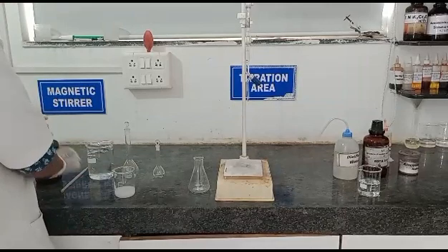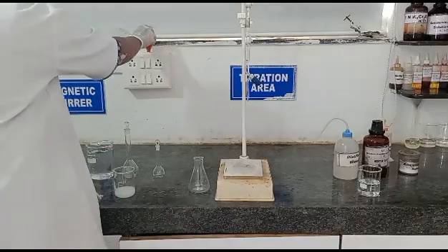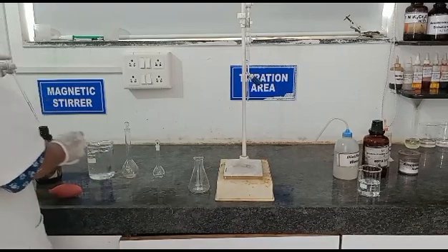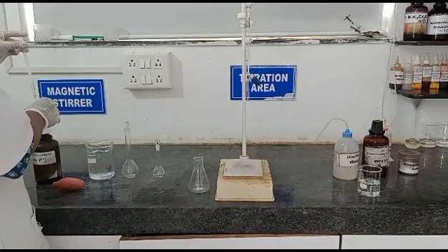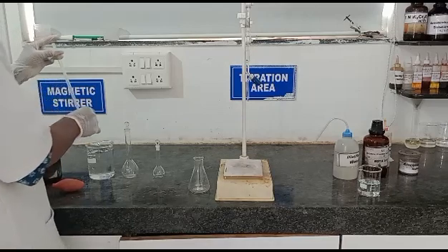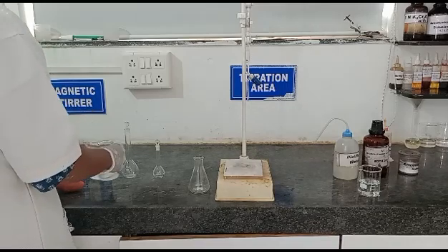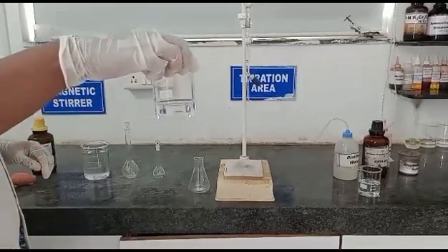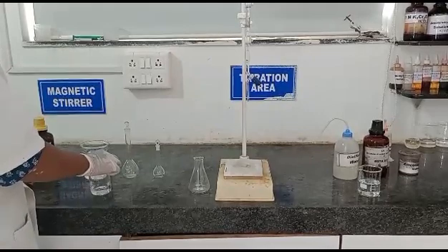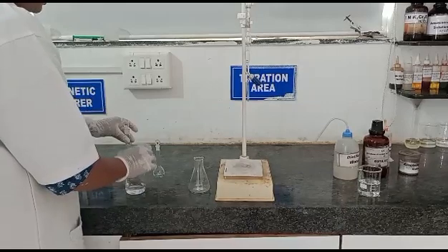If you can see over here, this is not completely dissolving in distilled water. So we will add around 2 to 3 ml of concentrated HCl. As you can see, it is dissolved after the addition of concentrated HCl. We will now transfer it into a 100 ml volumetric flask.